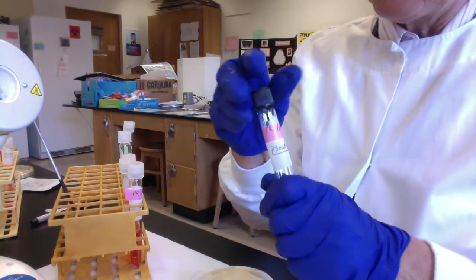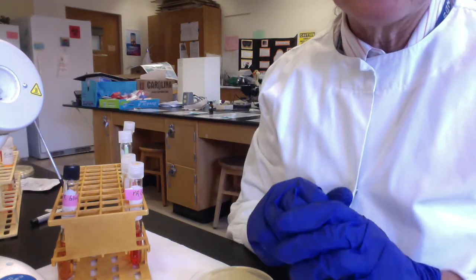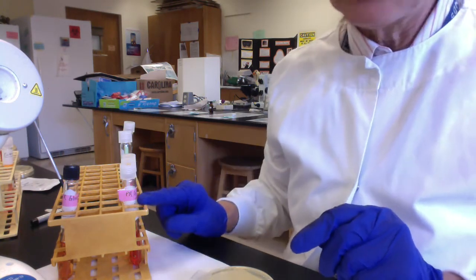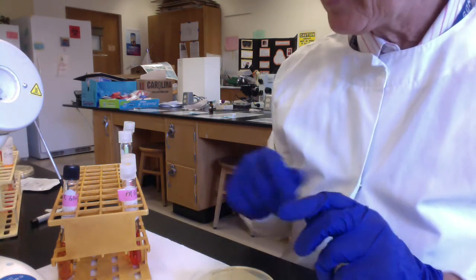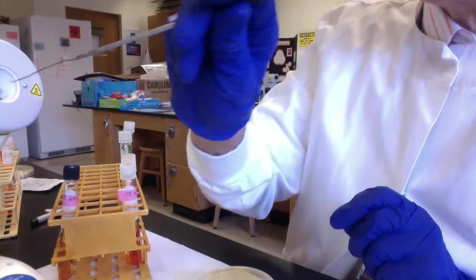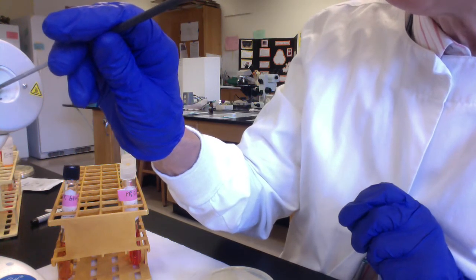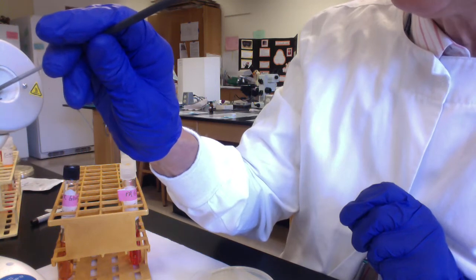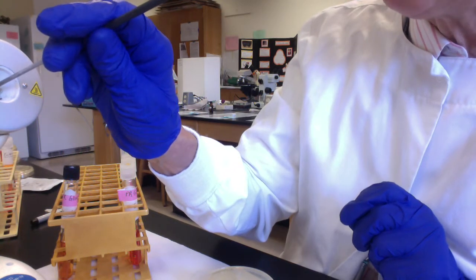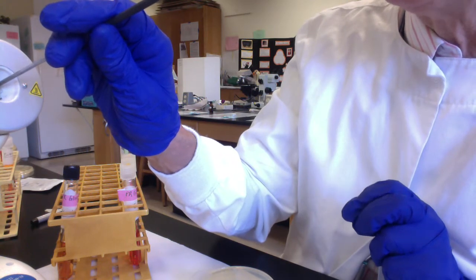Okay, so I'll show you quickly how we would use aseptic technique to inoculate three PR sugars. We're going to use PR glucose, PR lactose, and PR sucrose. I'll just use our good friend E. coli. E. coli is so adaptable, and we know for sure that it can ferment glucose. In our metabolism discussions, E. coli is often kind of our model workhorse.